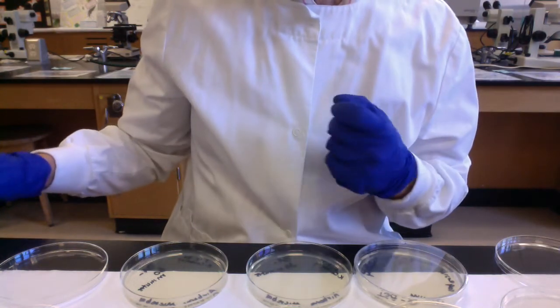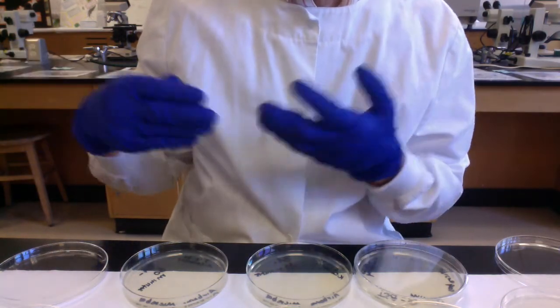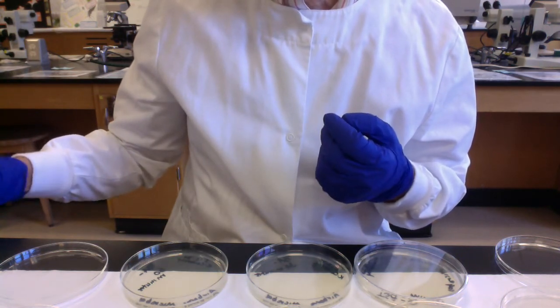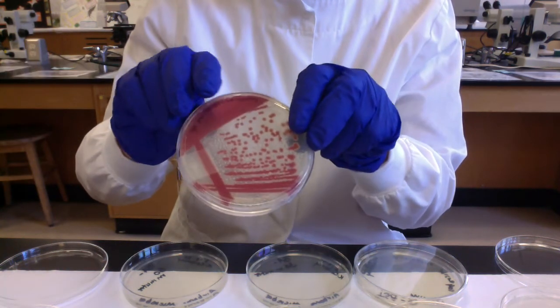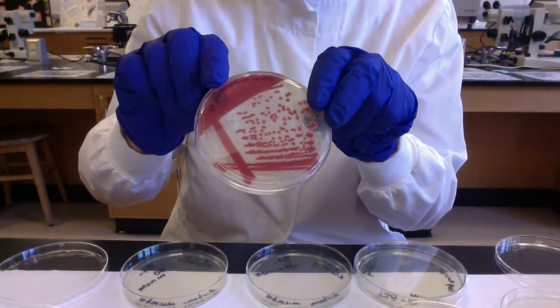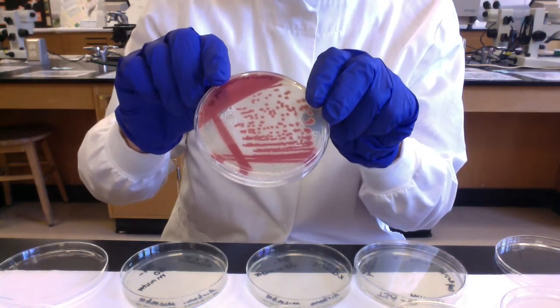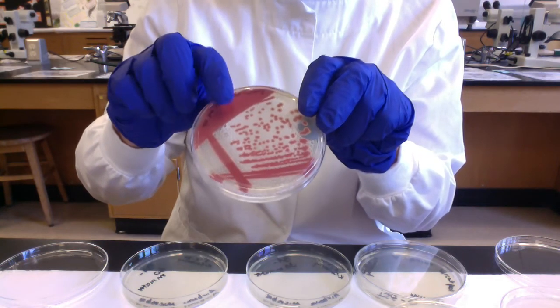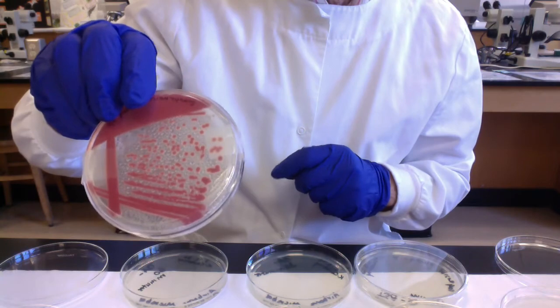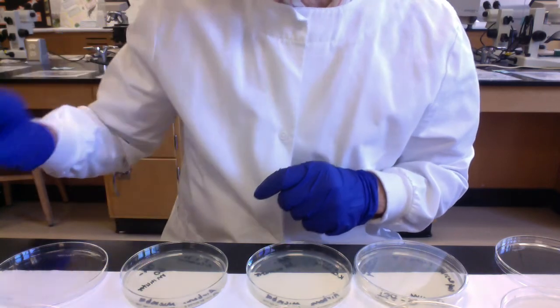And then, folks, just to finish up the little video here, I just wanted to show you some plates that Carmen and Val made, just to give you an idea of how different types of microbes will form different colonies. This is a beautiful Serratia marcescens. It has this beautiful brick red colony. This is a cousin of E. coli. It's one of the Enterobacteriaceae.